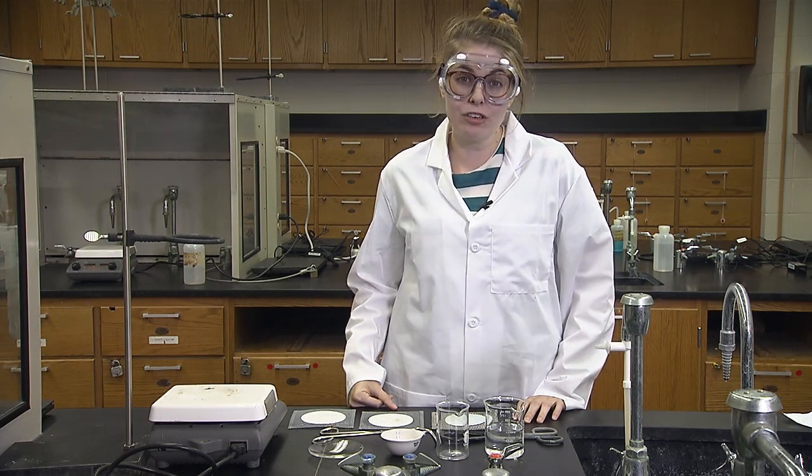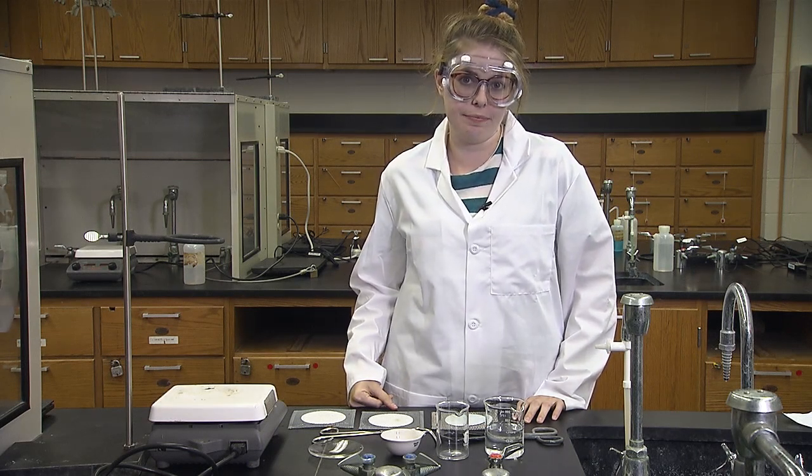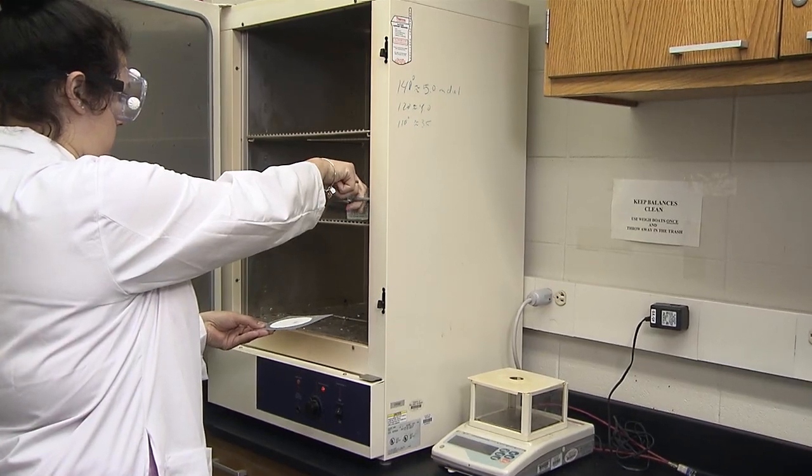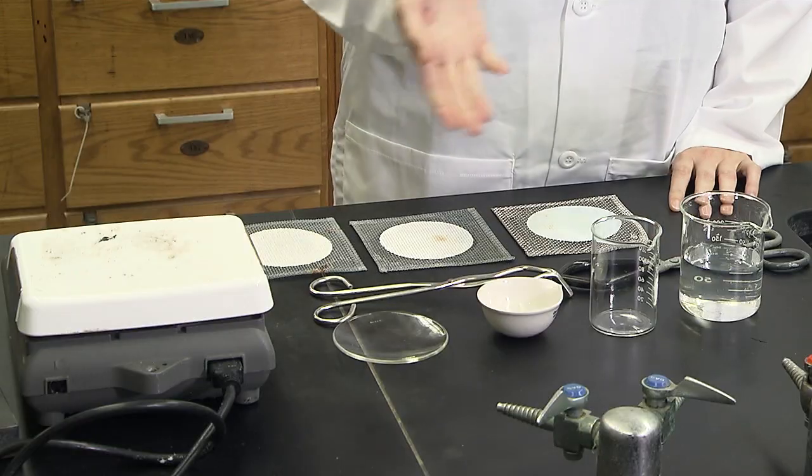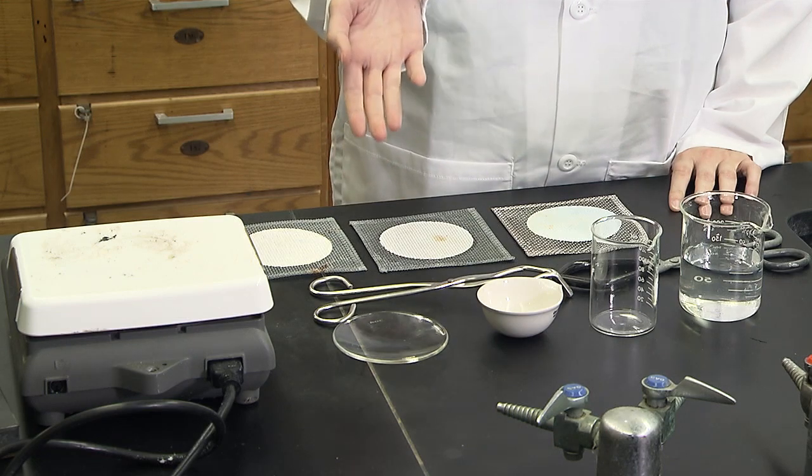Hi, it's Sophie. I'm here to show you how to handle hot glassware. In lab, you will frequently be asked to heat glassware on the hot plate or in the oven. Depending on the type of glassware, there's a type of tongs that will work best to help you.